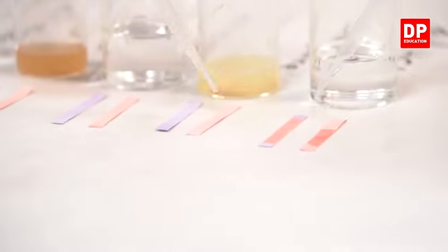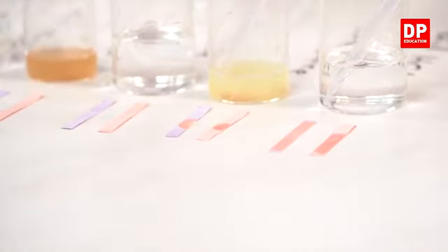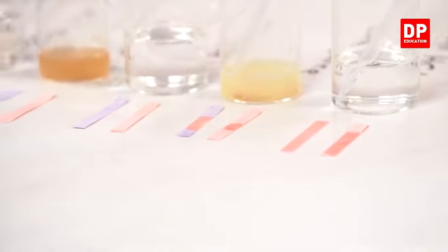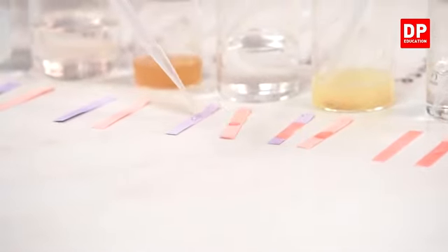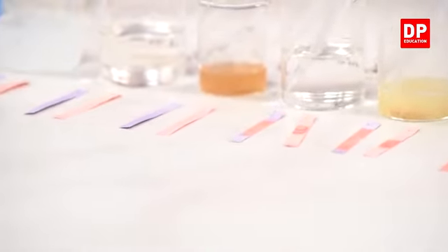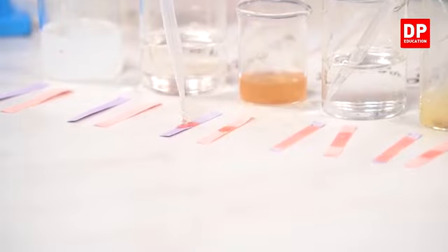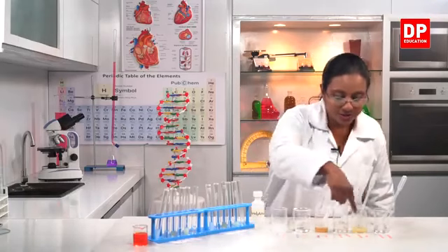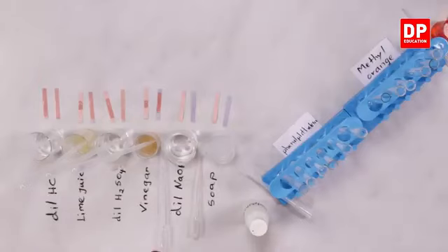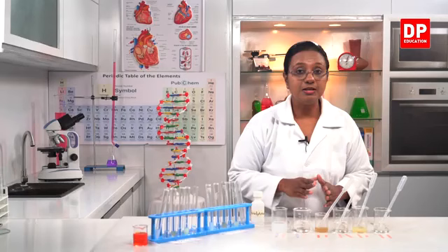Then the second one, I will put a drop of lime juice to the red as well as the blue litmus. Then sulfuric acid again to red and blue litmus papers. Vinegar to both red and blue litmus. So now you know the four solutions. Now can you all see the color change? The red litmus remains the same and the blue litmus is turning to red. So acids turn blue litmus to red.